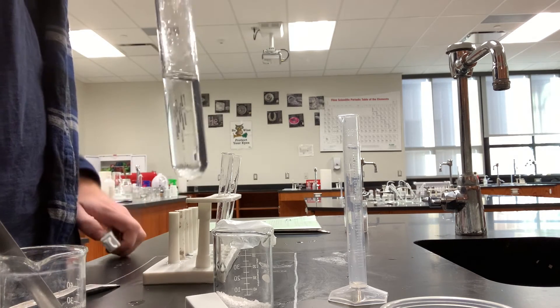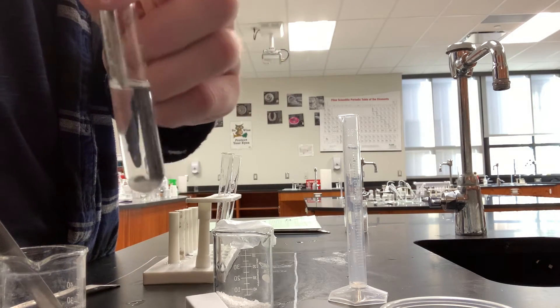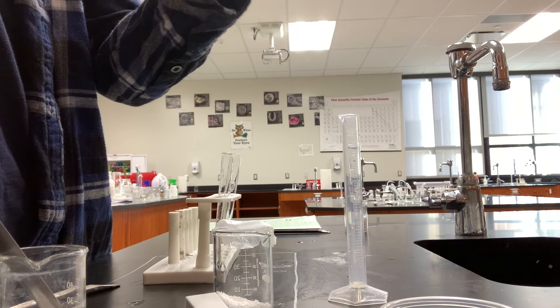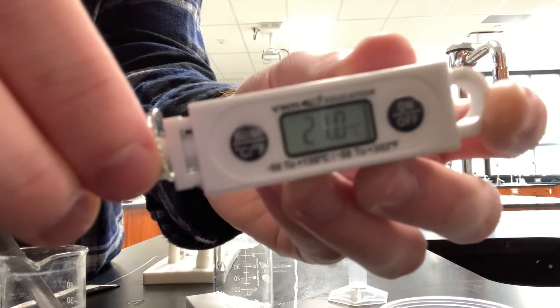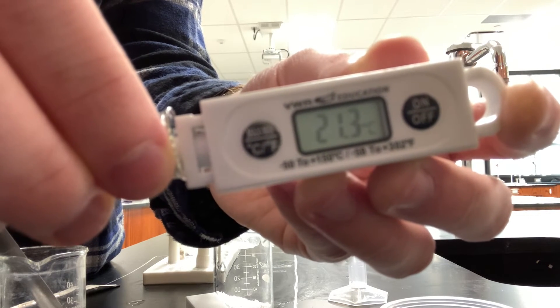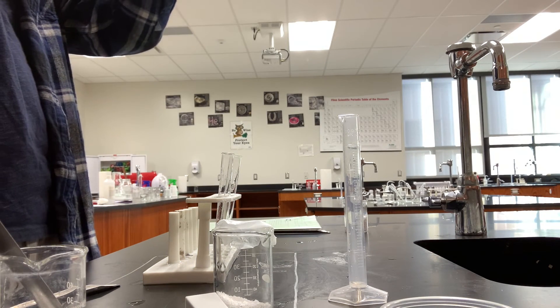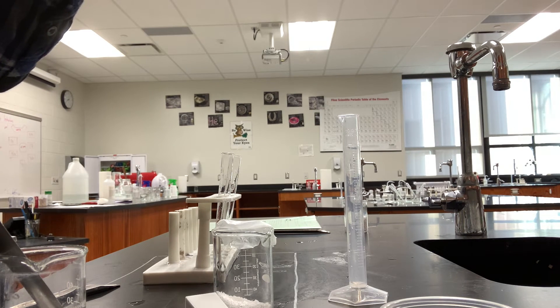It's been added and it's been dissolved, so let's check the temperature on that real quick. As you can see, there was a little change, but not much.